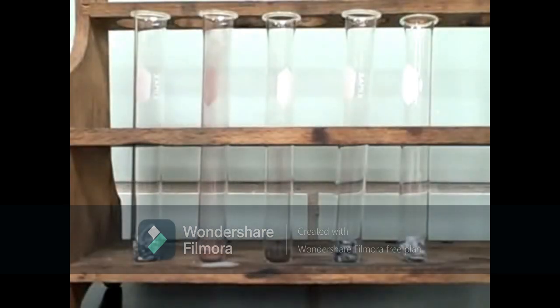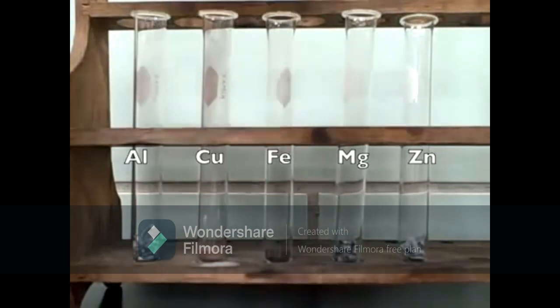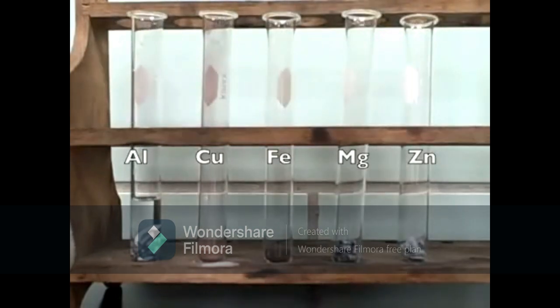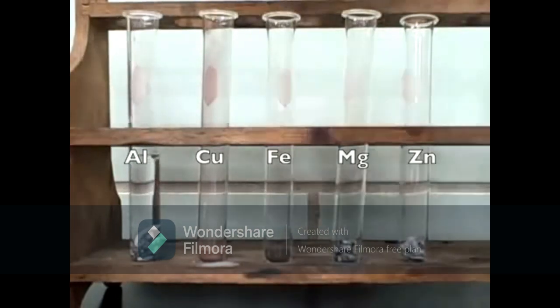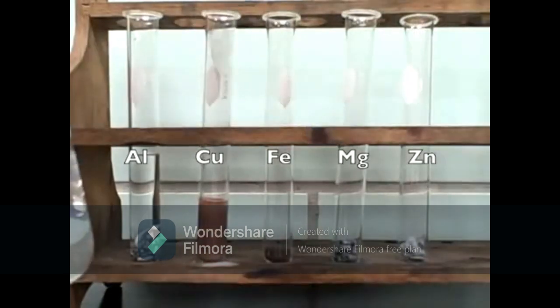In this lab, we are reacting 5 different metals in a single replacement reaction with 1 molar hydrochloric acid. From left to right, the metals are aluminum, copper, iron, magnesium, and on the end, zinc. So to each test tube, we will add an amount of hydrochloric acid, and we will measure its reactivity.